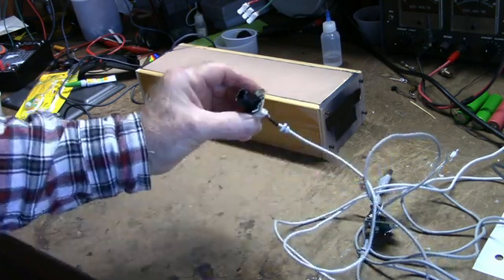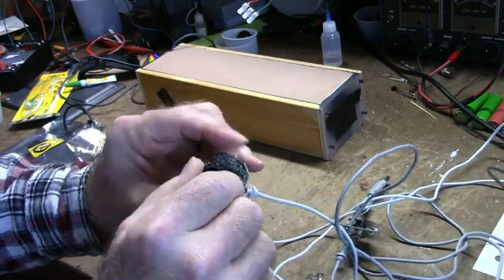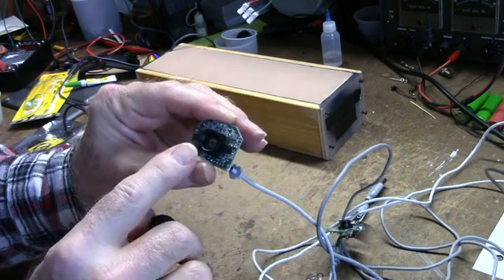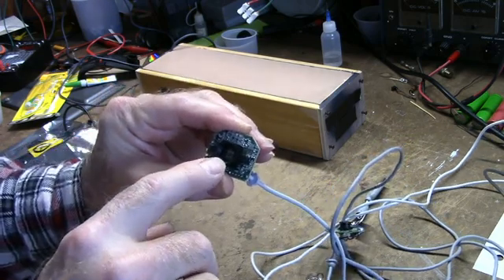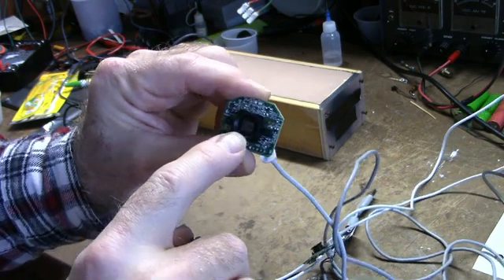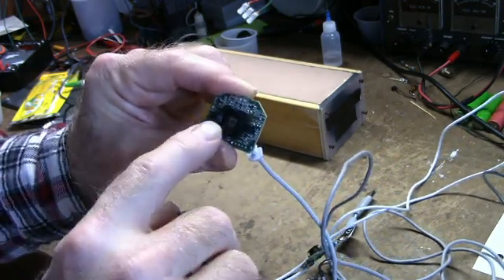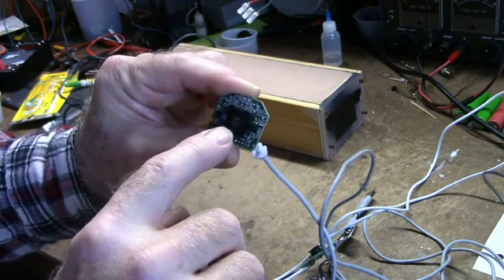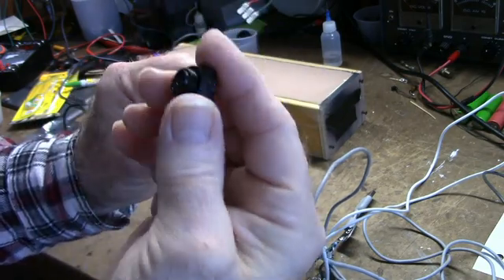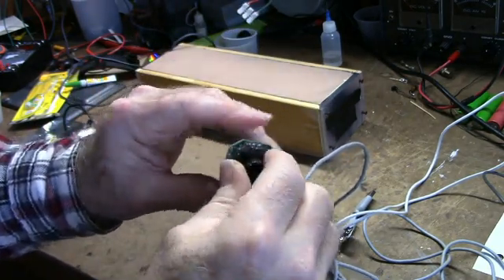And what you do is you take the camera, and here's one. Remove the lens, and inside, this had an infrared filter here. And I removed the filter. That way, it will measure some of the longer wavelengths. This device in here, the pickup is quite sensitive. And it also has a lens in here. And this is what you need.